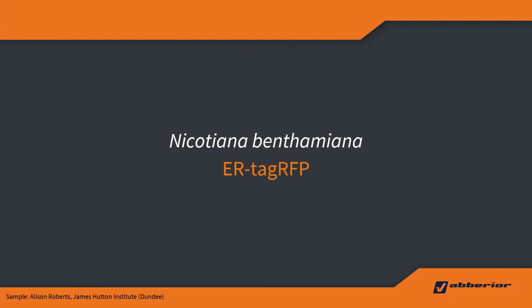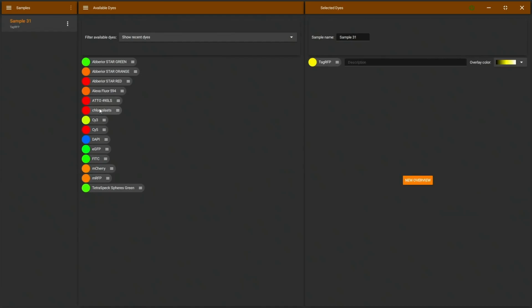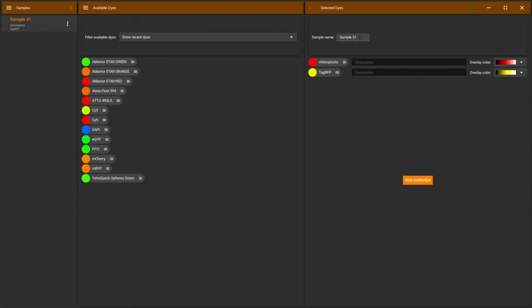With this, I would like to go to the microscope again, and we're looking at a tobacco leaf with ER tagged with tag RFP. Here we are back in the software. I'm going to start with a fresh sample. I'm selecting tag RFP and chloroplast, and I'm giving this a name, tag RFP ER, so that's an endoplasmic reticulum. I'll also select a few different colors here.